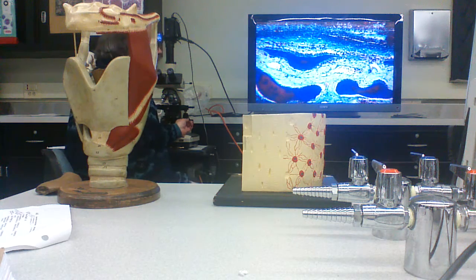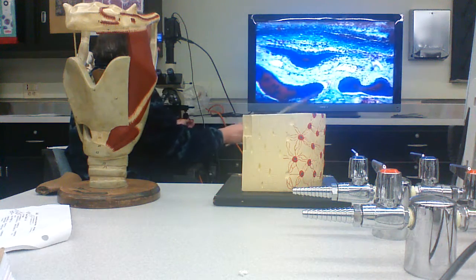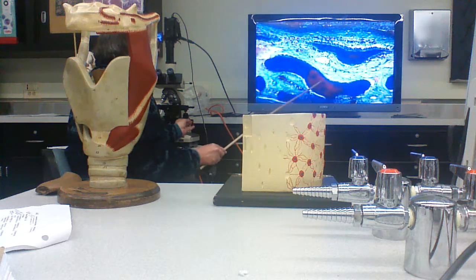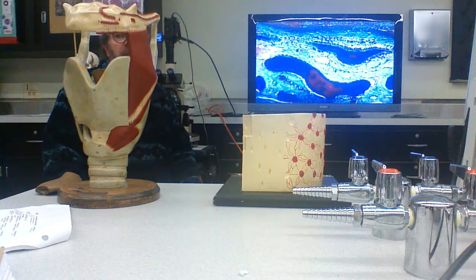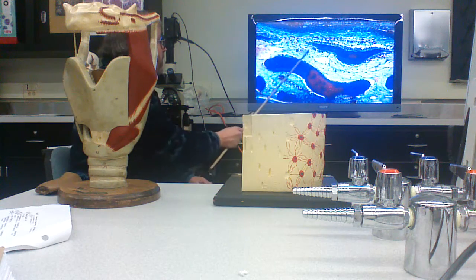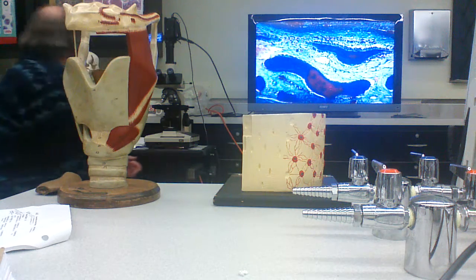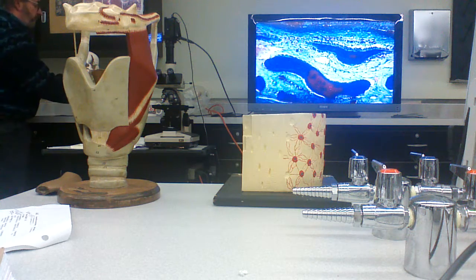So what you have here is you start making these plates of bones. These osteoblasts are making this plate. These osteoblasts are lined up making that plate. These osteoblasts are going to end up making that plate. What they're making is spongy bone, right? They're making spongy bone. Eventually, right, the plates are going to fuse, and you're going to see something that looks like this.